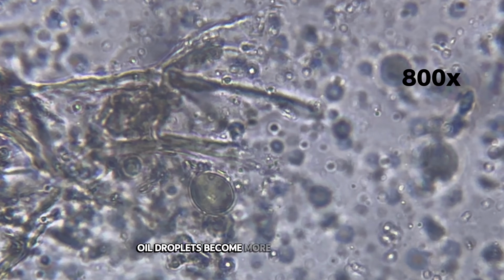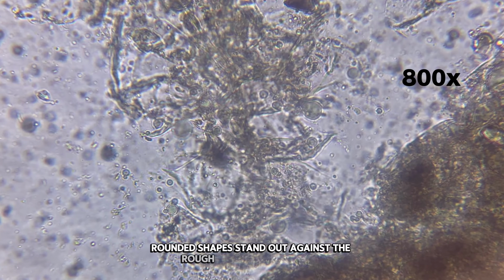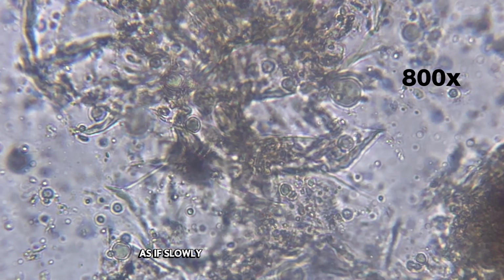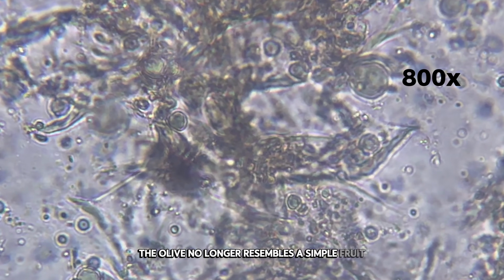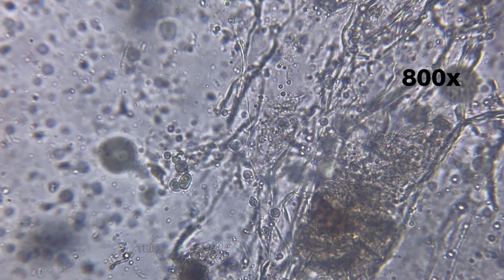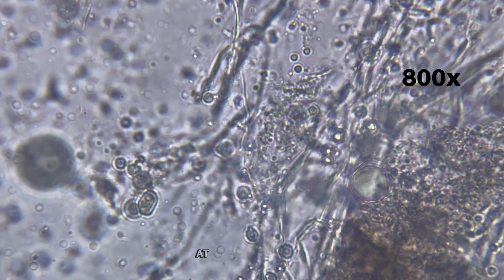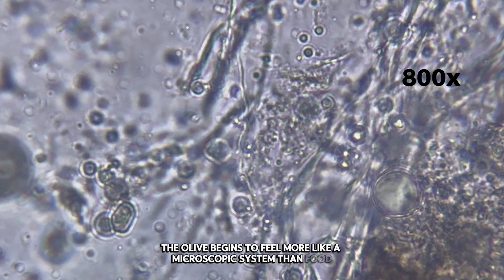Oil droplets become more prominent at this level. Their smooth, rounded shapes stand out against the rough, fibrous background. Some droplets appear embedded within the tissue. Others sit at the boundaries as if slowly separating from the structure. The olive no longer resembles a simple fruit. It looks engineered, layered, and highly organized. This complexity reflects the olive's role as an energy-rich fruit built to store oils over time. At this magnification, the olive begins to feel more like a microscopic system than food.